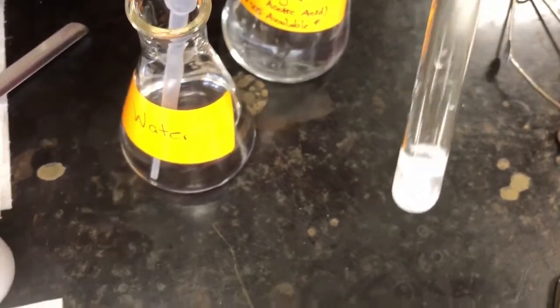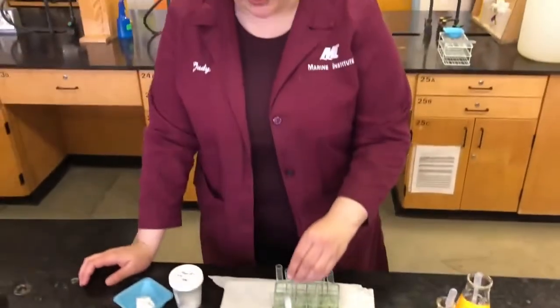So if we look at all of those results and compare them to our previous results, of the previous 6 compounds that you tested, which of those showed no reaction with heat, insoluble in water, and bubbles with vinegar? The only one that had all of those results, as well as being white and a powder, is chalk. So we can identify our unknown sample. C, in this case, is chalk. So that's how we identify unknowns. One method of identifying an unknown. We may look at some other methods later on, but that's one method we can use for identifying an unknown substance.